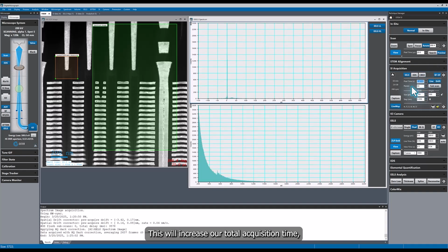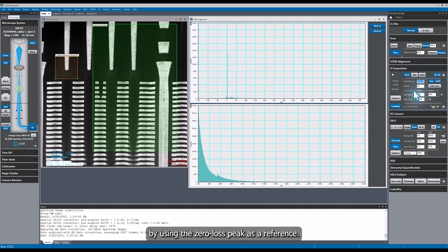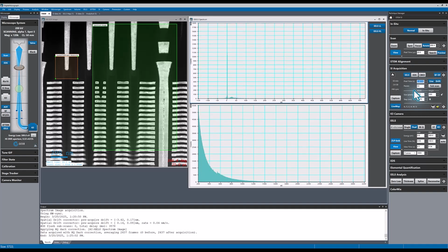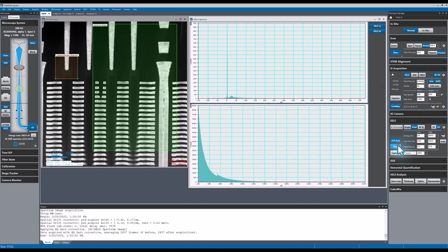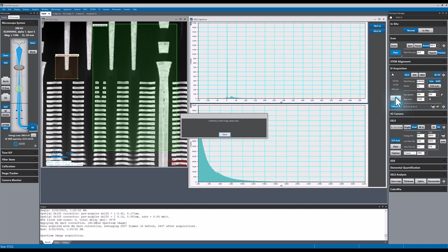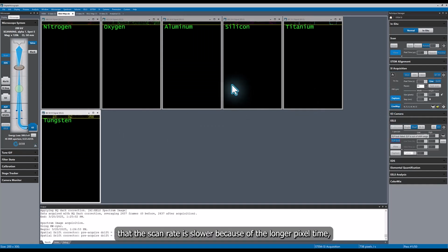This will increase our total acquisition time, but it will allow us to calculate the absolute elemental concentration, and it will have absolute energy scale calibration by using the zero loss peak as a reference. I will keep all of the ROIs in the same area and start the acquisition. We notice that the scan rate is slower because of the longer pixel time, but we are still able to monitor the live elemental maps.